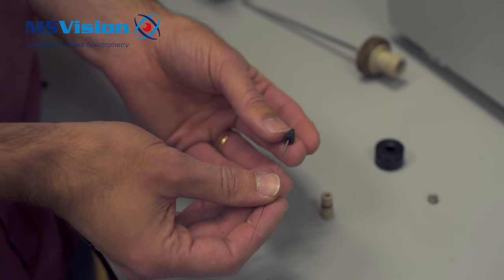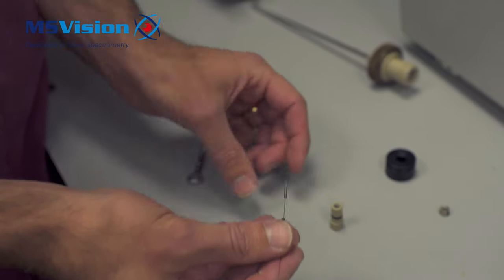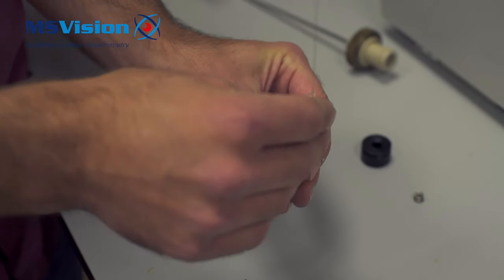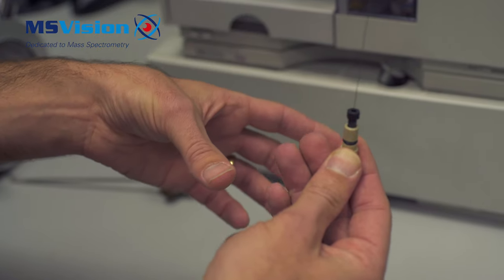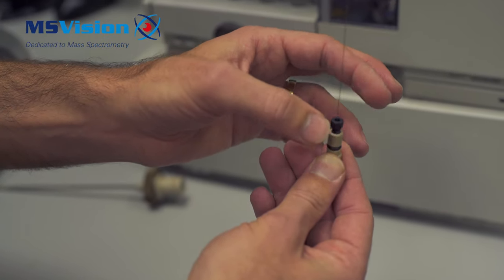Slide the new capillary into the backing nut and replace the backing nut into the ZDV connector, allowing the capillary to fall down into the ZDV to get to the correct position.